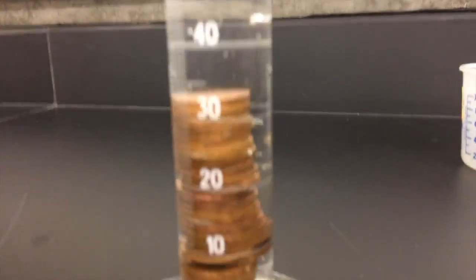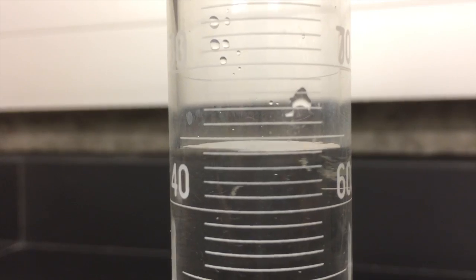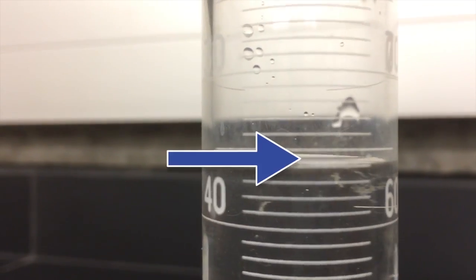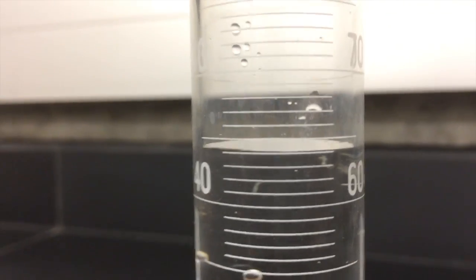You can see that we've done that with all of our pennies, so all 40 are in there, and then you're going to want to end this by recording the final volume, and we've marked that with an arrow there.